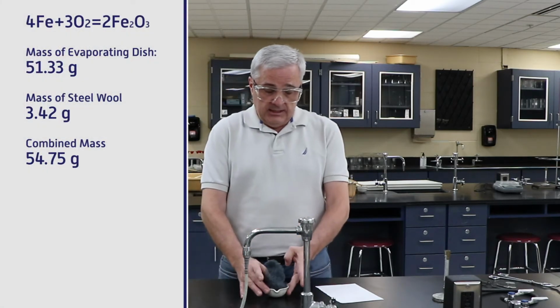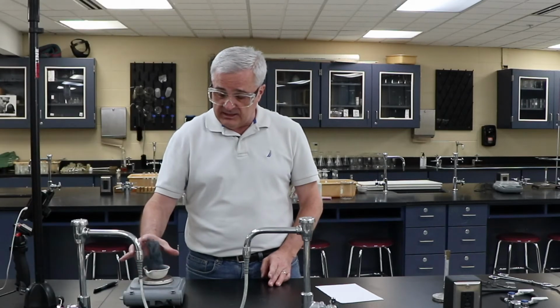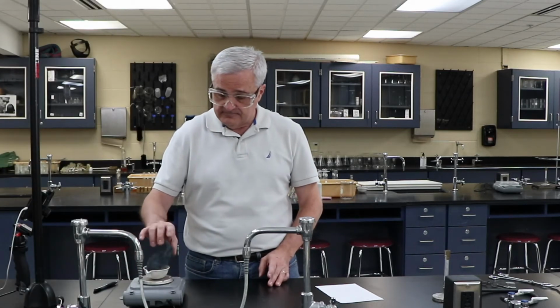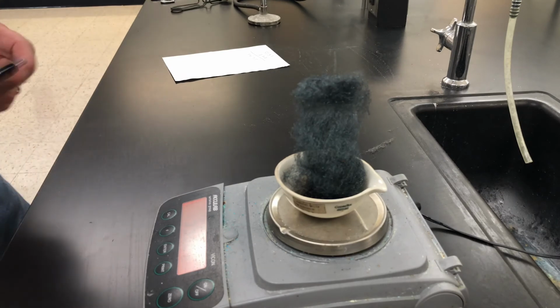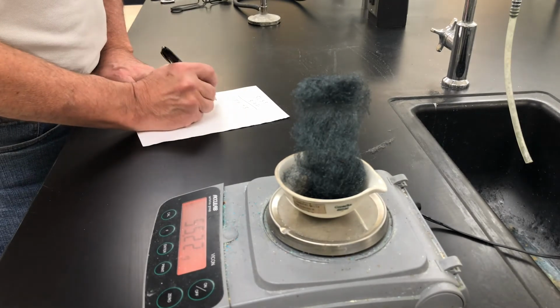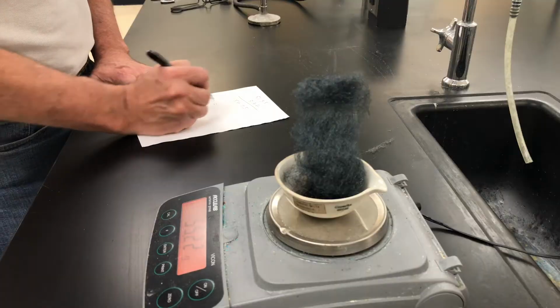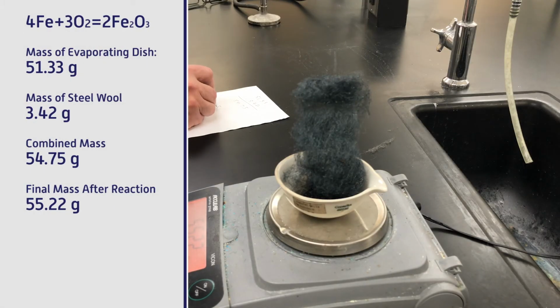It is very touchable. I'm going to put it on here, trying to get everything and keep it all in there. I have a final mass: the mass of the product and the evaporating dish equals 55.22.